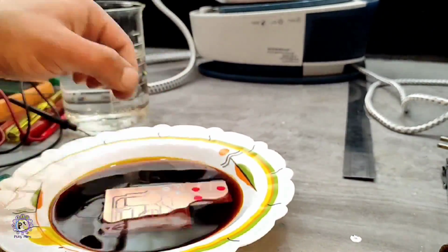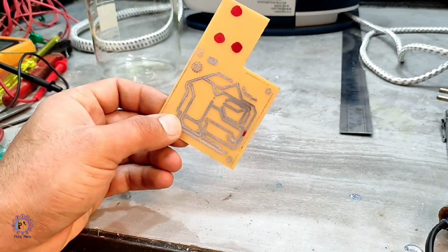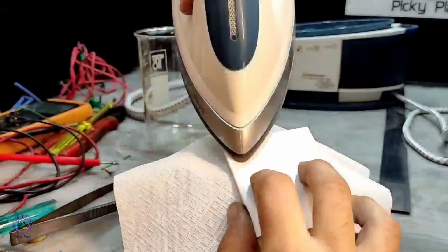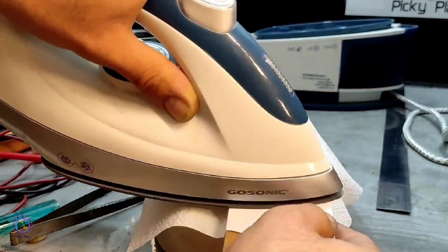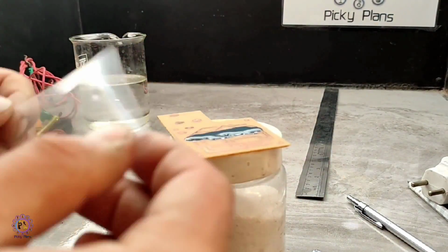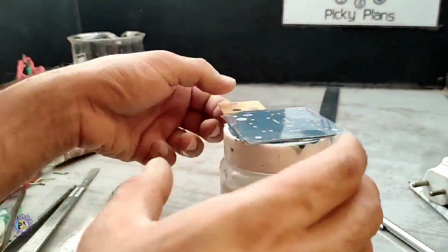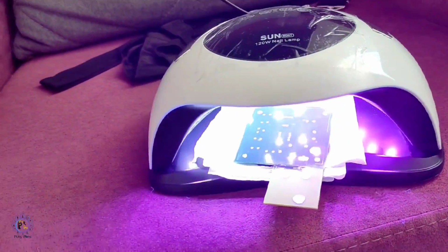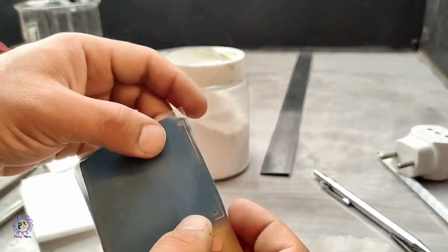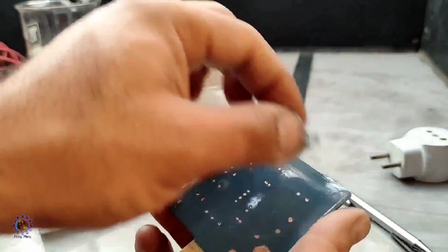When the etching process was done, I removed the PCB from the etching solution and I was really happy with achieving such a satisfactory result. Afterwards, the silk screen was printed in exactly the same manner. Then I used a UV curing nail polish as a solder mask. After that, it was placed under the UV light to become completely cured. There we go, the solder mask was completely cured after just 15 seconds.